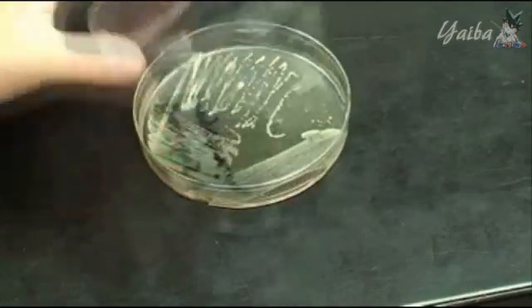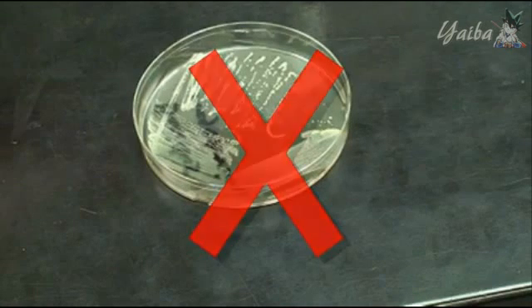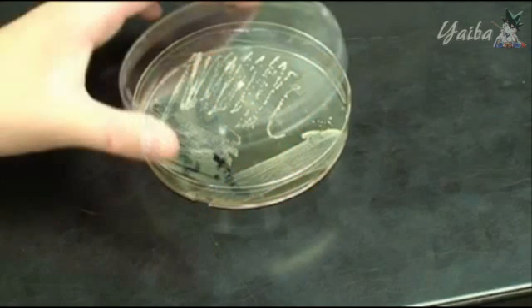Whenever you work with plates, never completely remove the cover as you seriously risk contamination. It is also good to avoid sneezing, coughing, and digit flailing. Even breathing can be risky. The best practice is to hold the cover just above the plate, tilted slightly to allow for access while reducing the risk for contamination from airborne particulates.